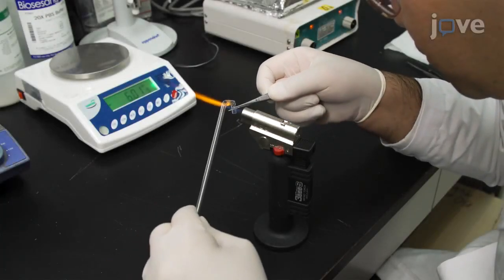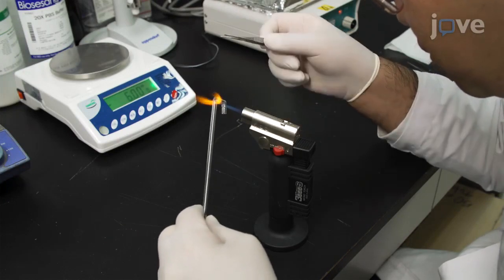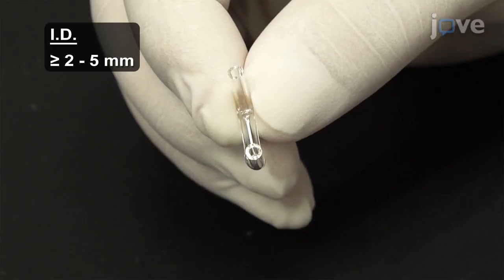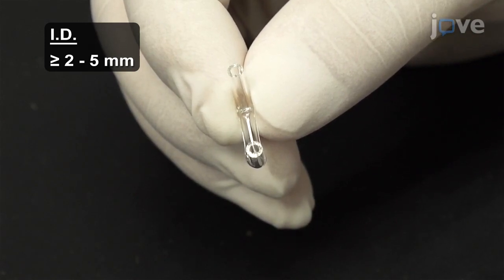To begin this procedure, bend the fired glass capillary tube to form a U-shape. The inner diameter of the capillary should be large enough for reducing series resistance when recording large ion currents.